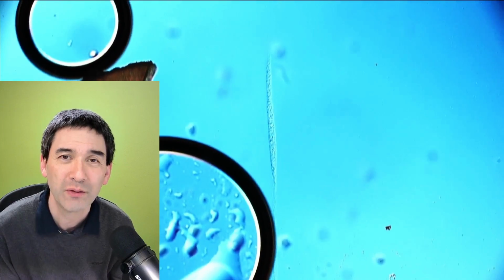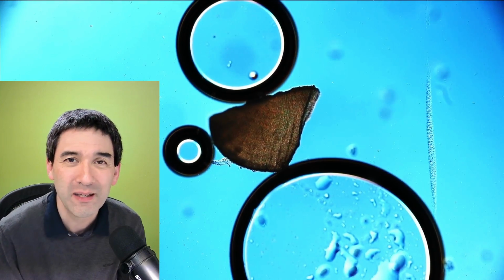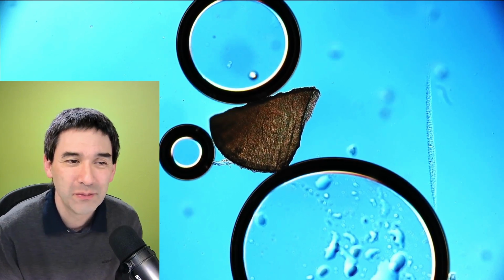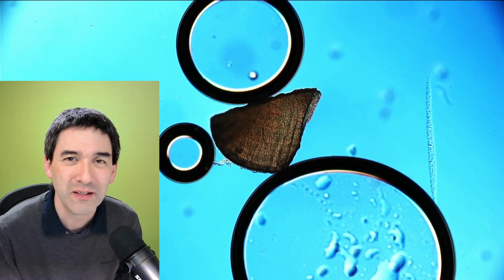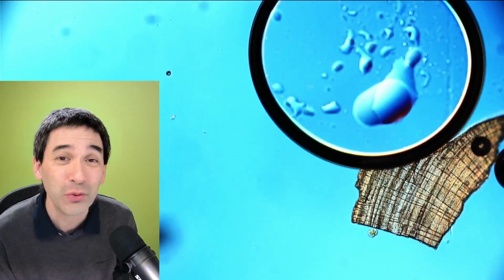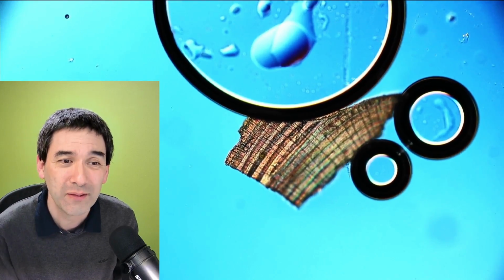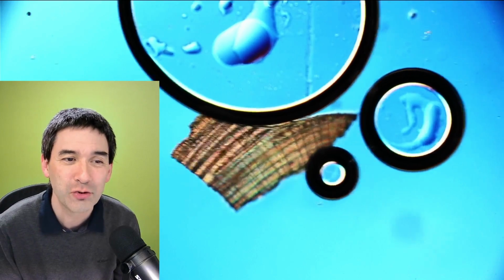And I found another one over here at the top. Here's another fragment, and it's also making those bubbles. It was kind of interesting to observe that. By the way, this is in real time, so there is no time lapse. It's the original speed that we see here. So you see that it's a fairly strong reaction, right?